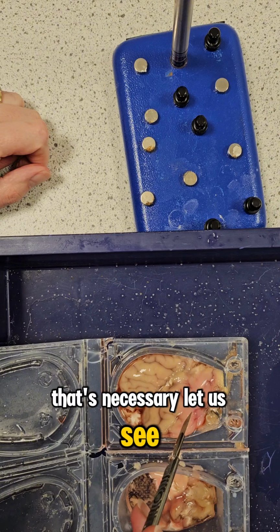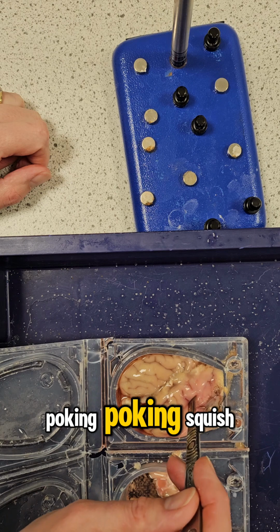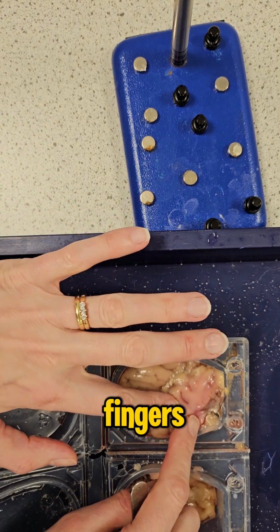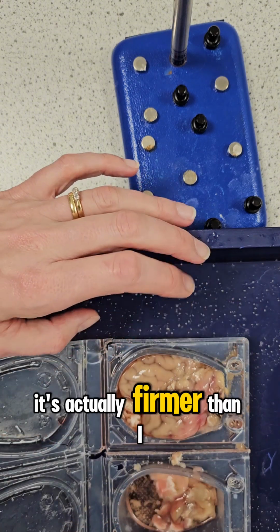Let us see. Ooh. Did you see that? Ooh. Poking. Squish. Slight blancmange. I'm now going to revolt you all by touching it with my fingers. It's quite squishy. Well, you know what? It's actually firmer than I thought.